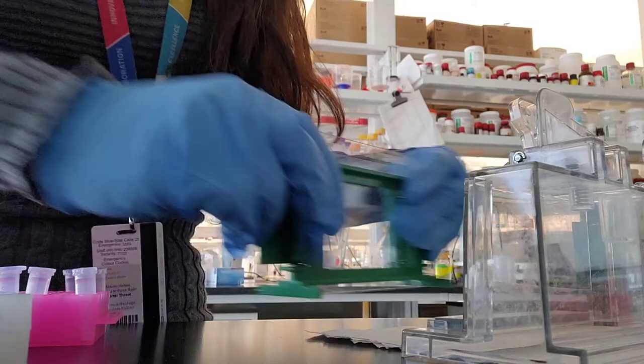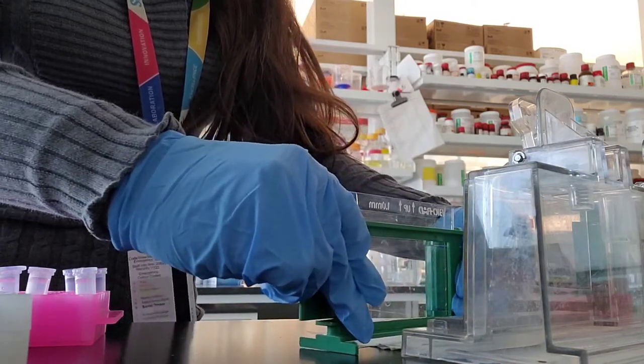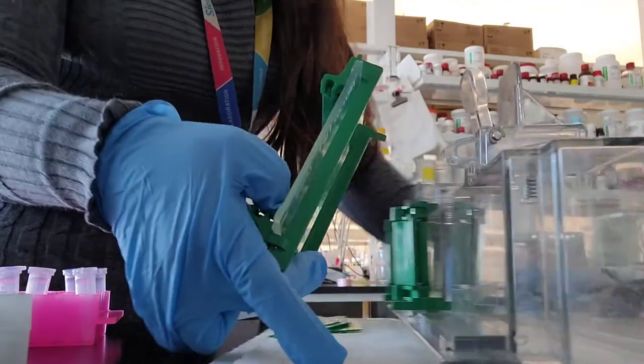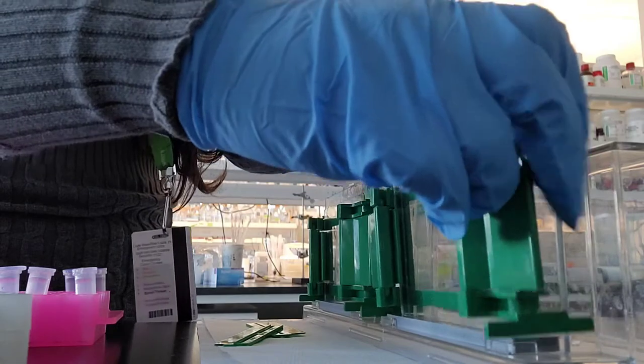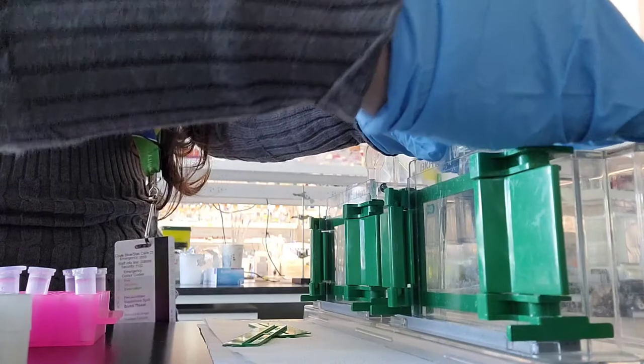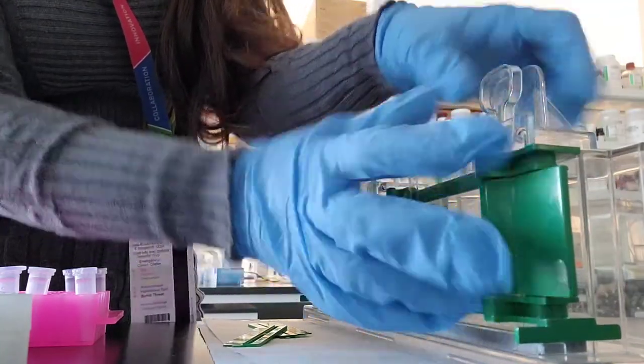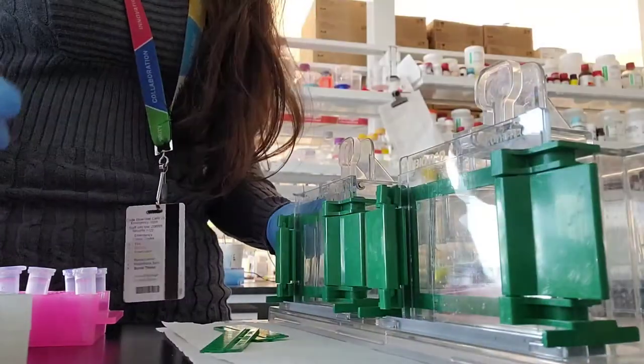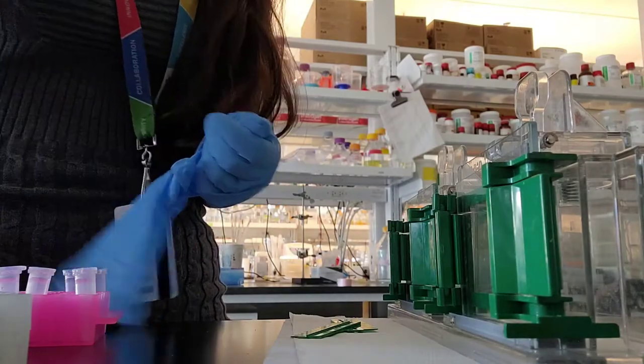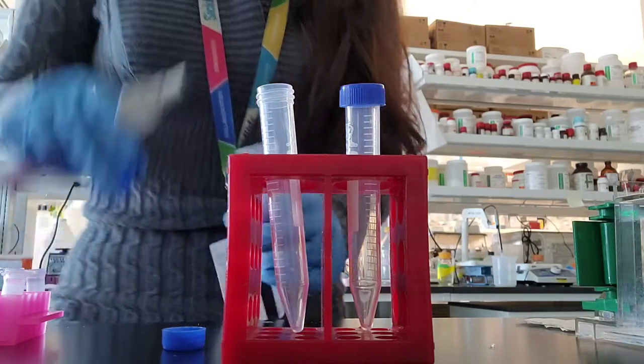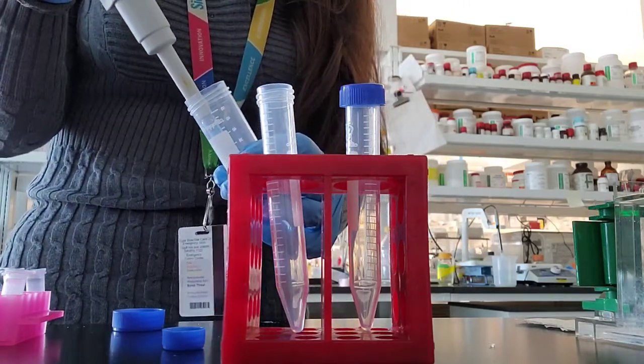Make sure there is no gap in the bottom because if there is even a little bit you're going to get leakage of your gel when you're pouring it in, and that will be really annoying. You can even check your apparatus to make sure your glasses don't have any broken edges in the bottom.